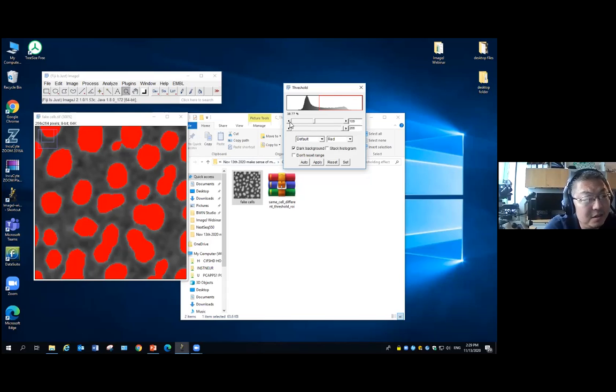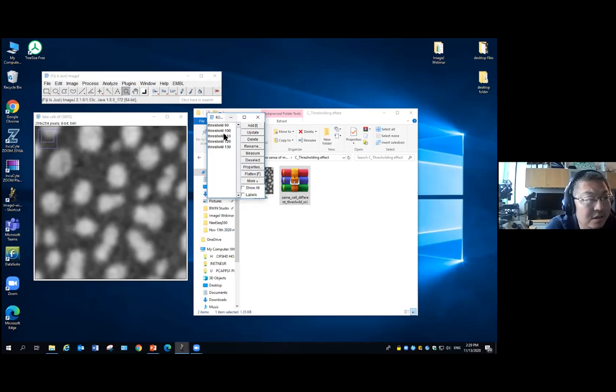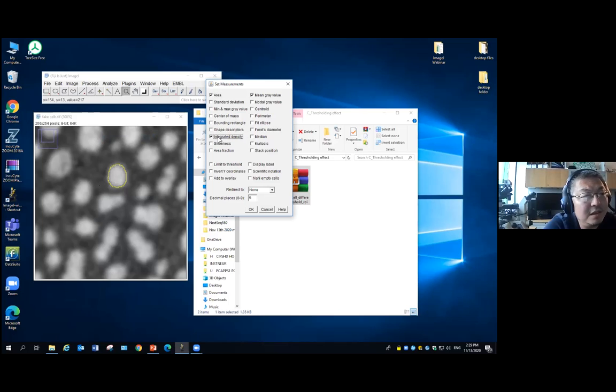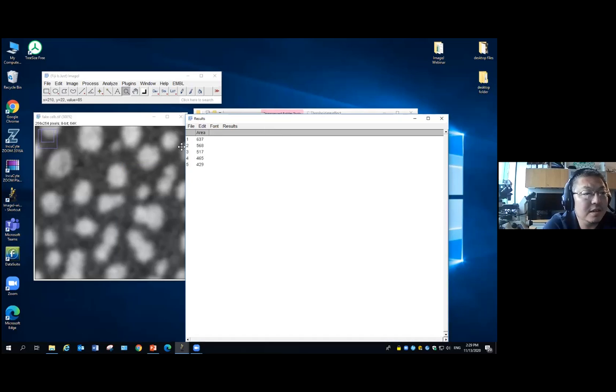But if you use a different threshold, you will see the cell size changes. If you put this zip file into this, I actually have different outlines of this cell using different thresholds. So this is if I use threshold 90, all the pixels inside this outline have intensity higher than or equal to 90. This is 100. You can see it's getting smaller, smaller, and smaller. So when we measure the size, you will see the size also getting smaller, smaller, and smaller. I deselect this. Let's say I only measure the size. I don't care about intensity. I measure it. So this is the size.